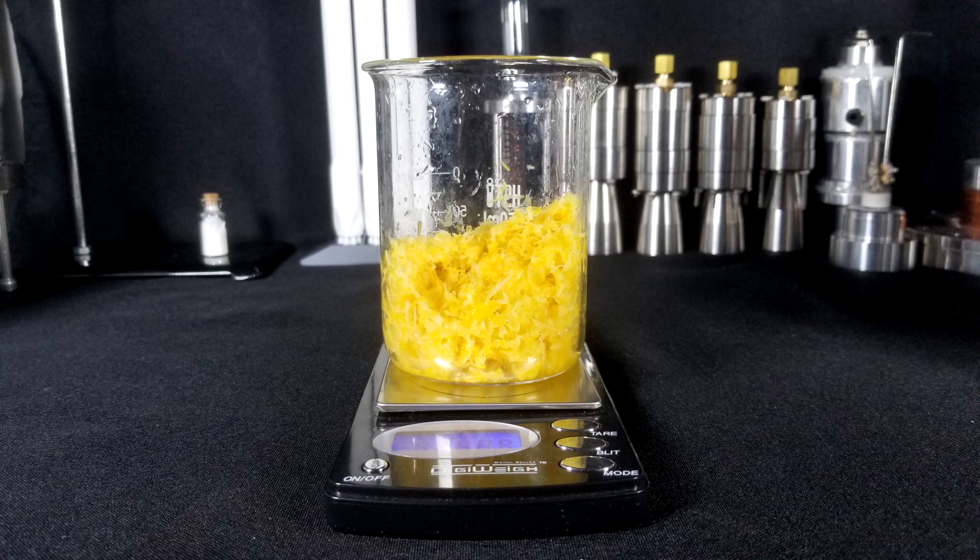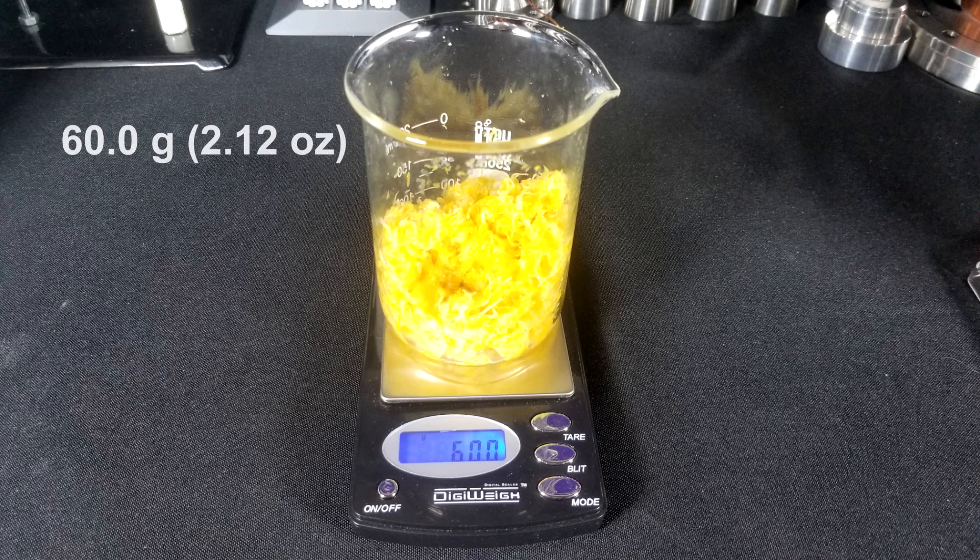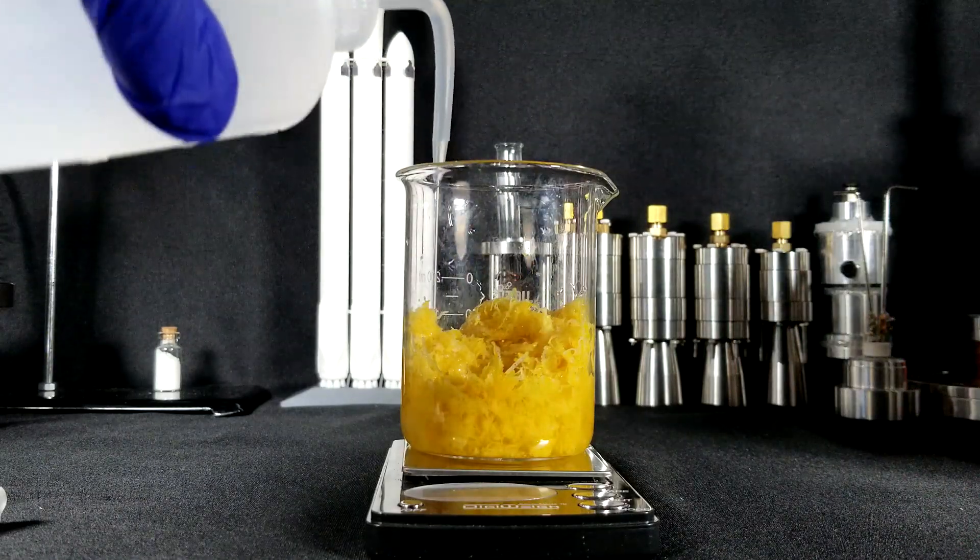I then transferred the skin into a small beaker after zeroing a scale. The initial mass is about 60 grams, and then I poured it into water to let all the skin soak.